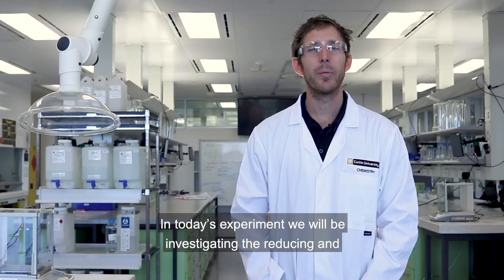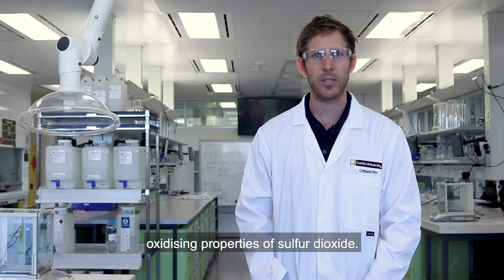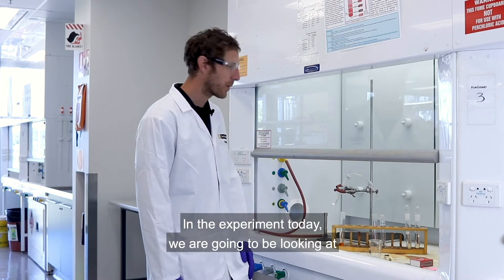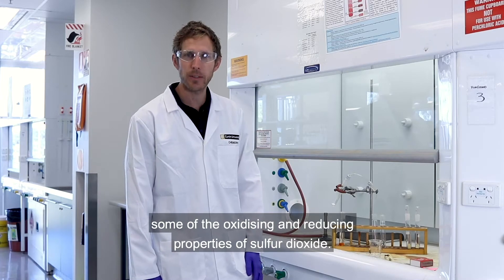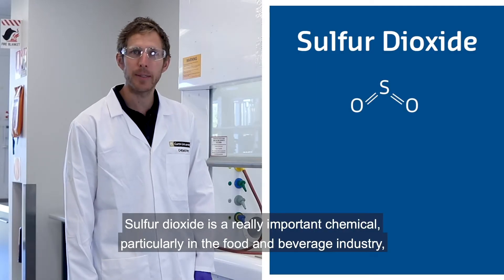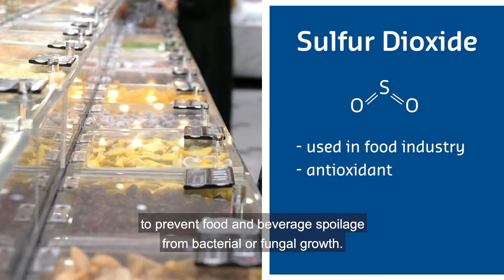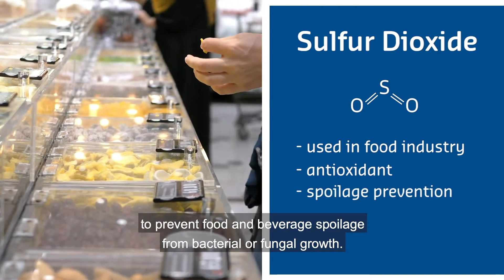In today's experiment we'll be investigating the reducing and oxidizing properties of sulfur dioxide. Sulfur dioxide is a really important chemical, particularly in the food and beverage industry, where it can be used as an antioxidant or a chemical compound to prevent food and beverage spoilage from bacterial or fungal growth.